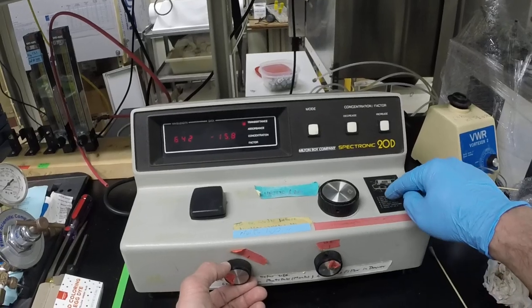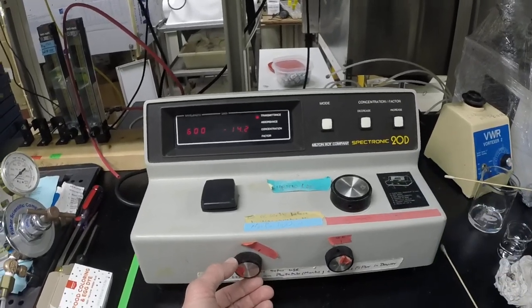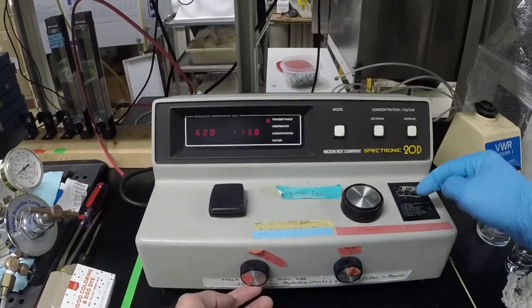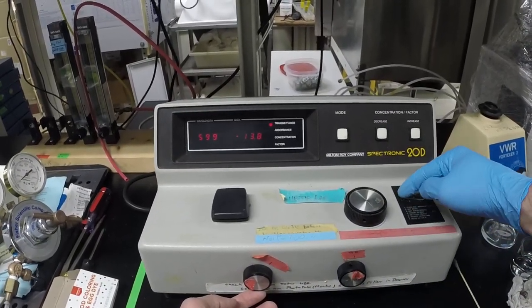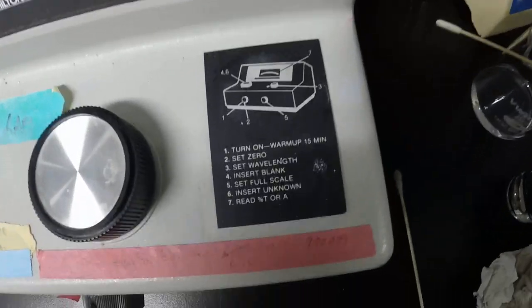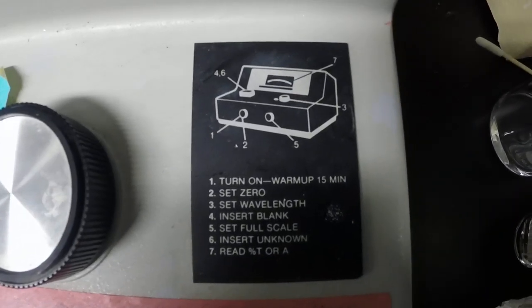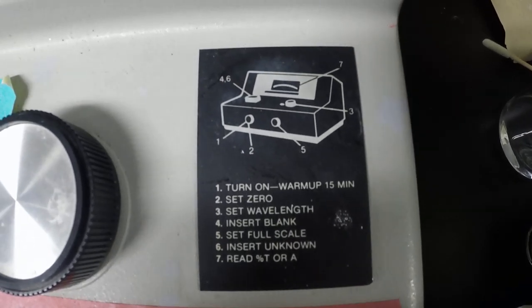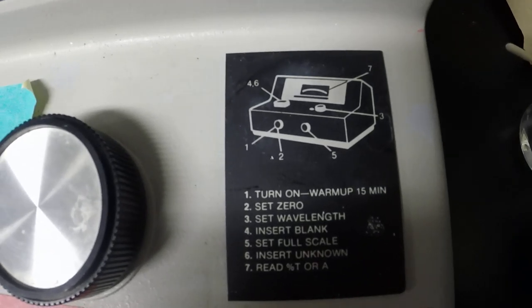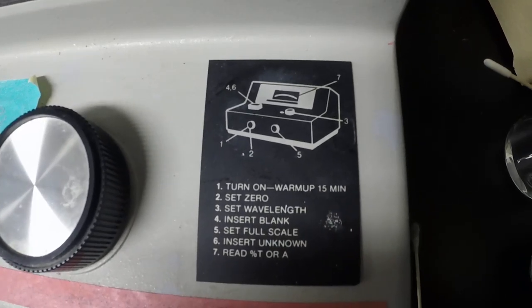under normal circumstances, you turn number one corresponding to the button in the front. So each of the steps corresponds to a number on the actual diagram, and if you take a look at that diagram, what you can see then is step one and two are the same button. That's just really changing the amount of output to the bulb.